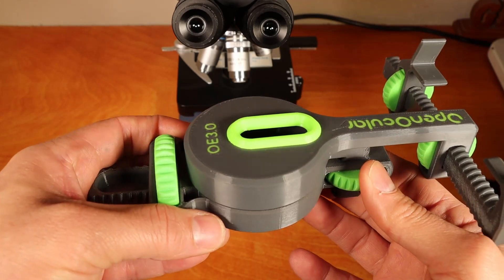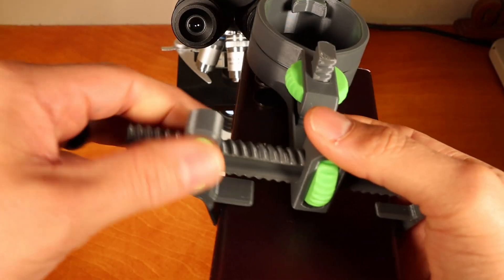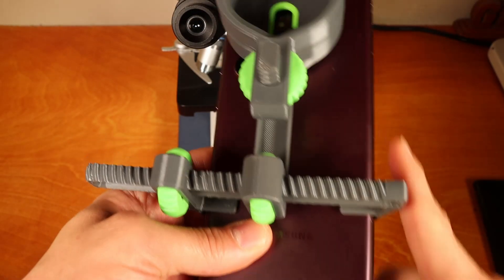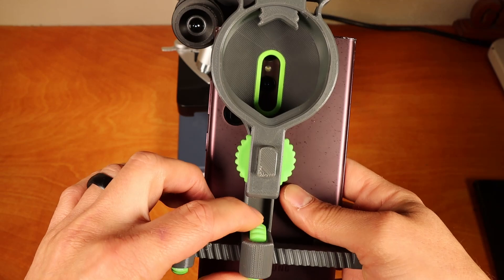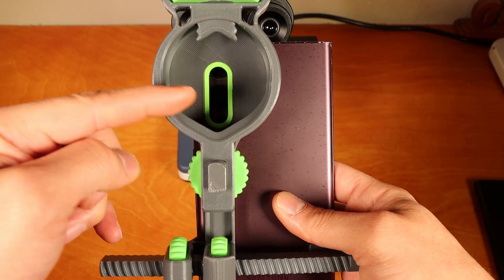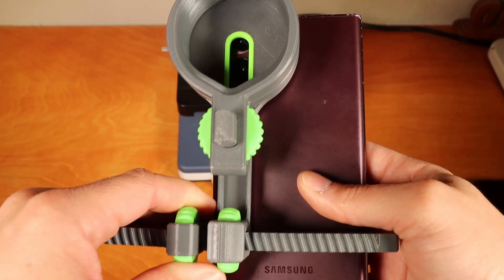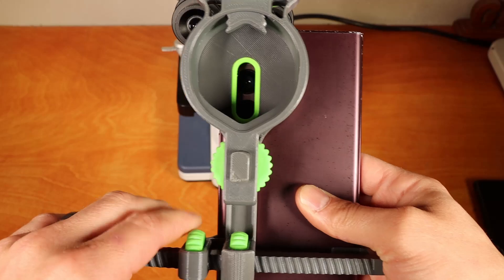You can set the eye relief at the perfect distance. I start by holding the smartphone in one hand with the cameras facing me, then place the adapter on top and tighten it to a certain degree. The Y axis moves along the edge of the smartphone. We can start by adjusting the X axis — turn this knob and move it so the cameras are within that slot. Once the camera is centered, tighten it all the way down. If you need to adjust, just loosen it, move it along the clamp, and retighten.